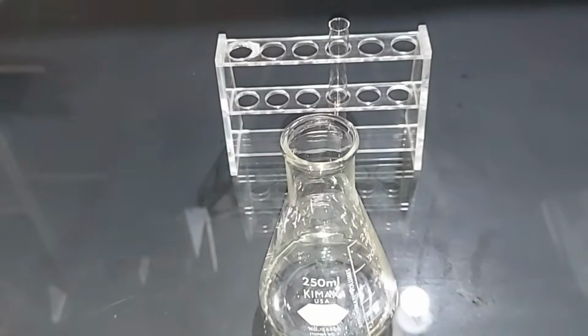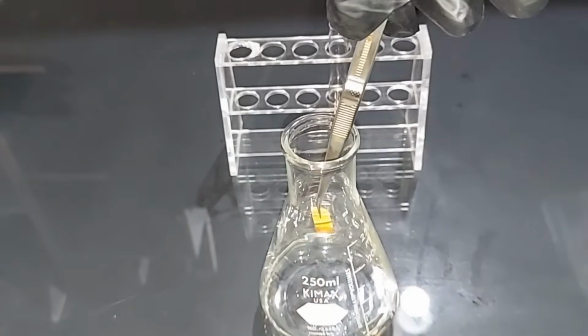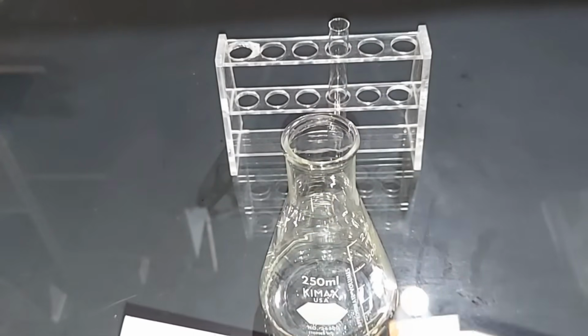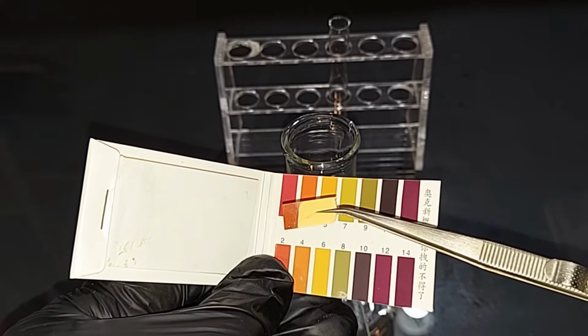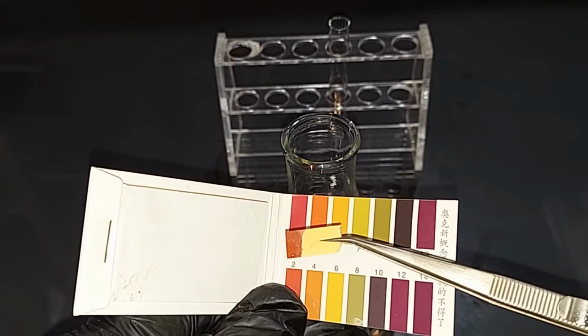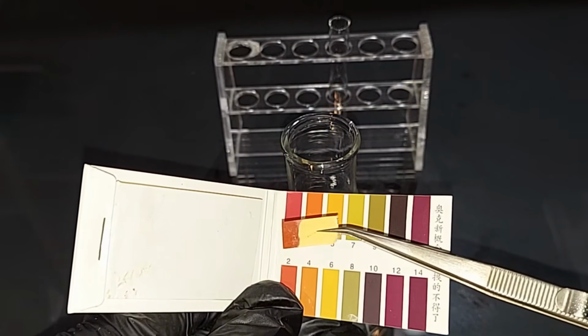First thing I'm going to do is just test the pH. This will, of course, not give us the most precise pH, but it will tell us if there are protons or hydrogen in the solution. Bring that up here. You know, that's between a 1 and 2. Now, 70% sulfuric acid would give you around a 1, and I would say that's pretty close to 1 right there, actually. So we know we have protons in the solution.